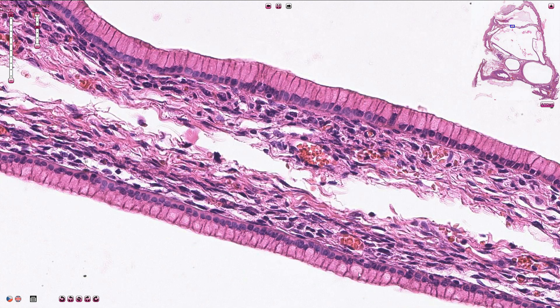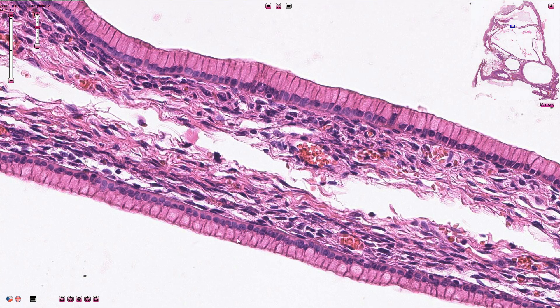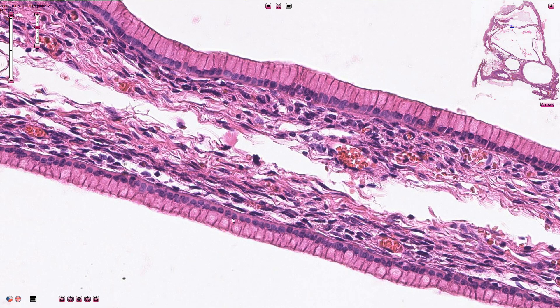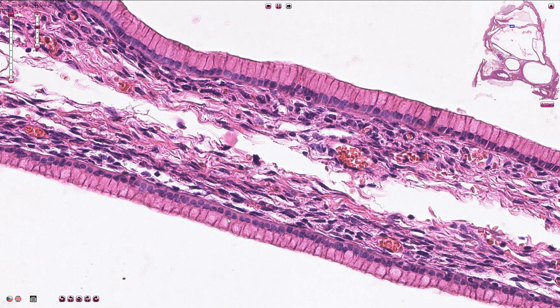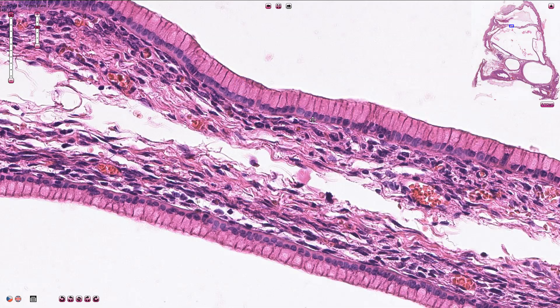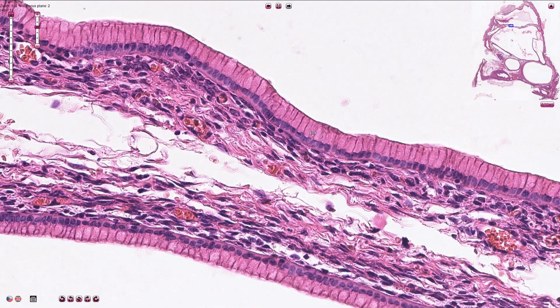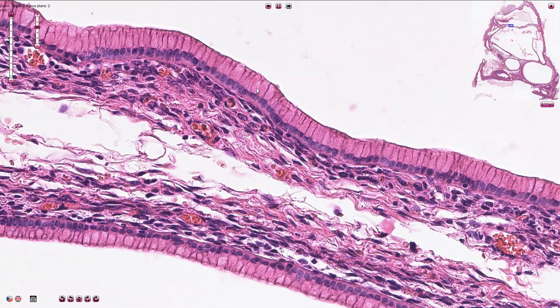Here we see a lot of mucin droplets. If we use PAS stain, the mucin would be strongly positive. This is the mucinous type of epithelium, and it is exactly the same type of epithelium which lines the endocervical glands.